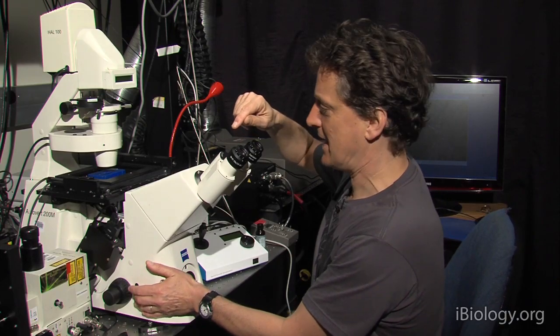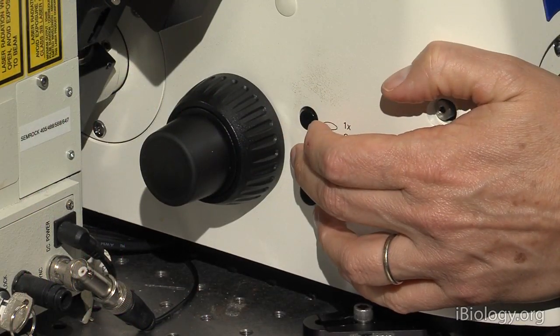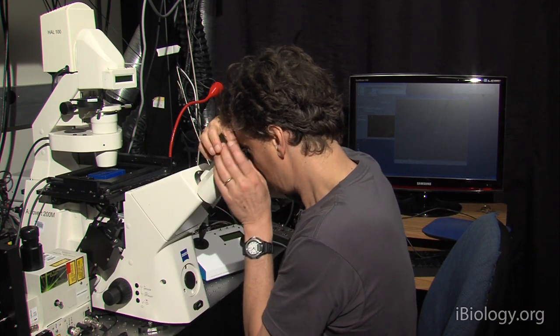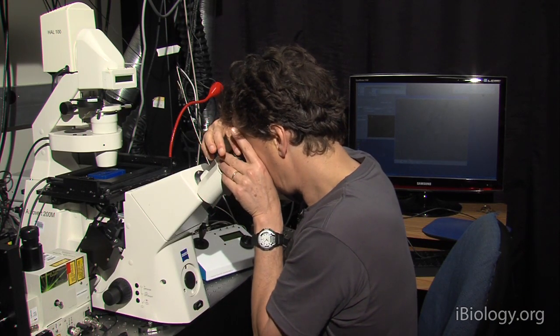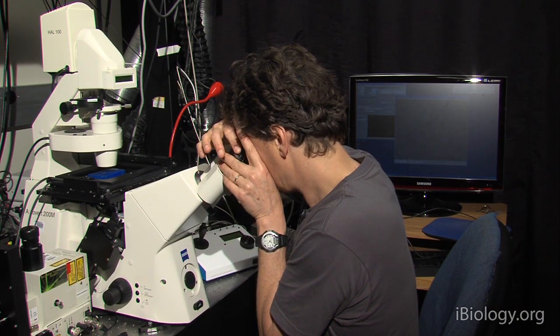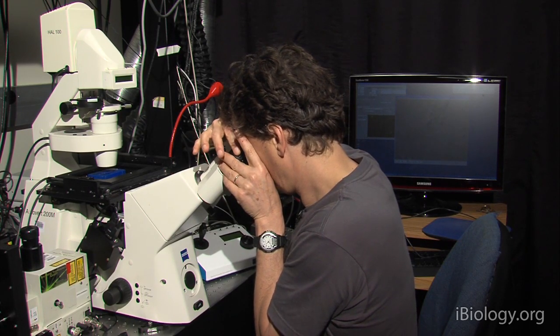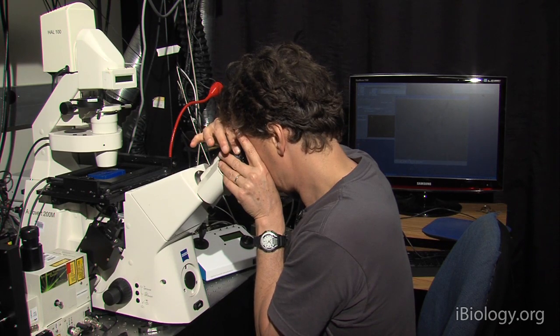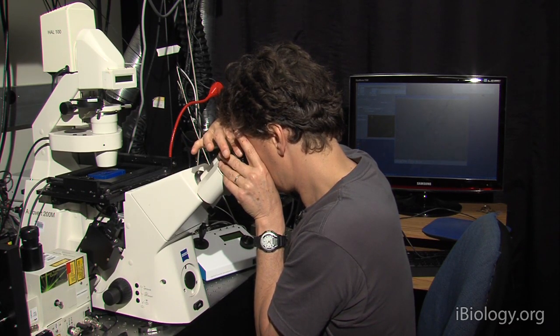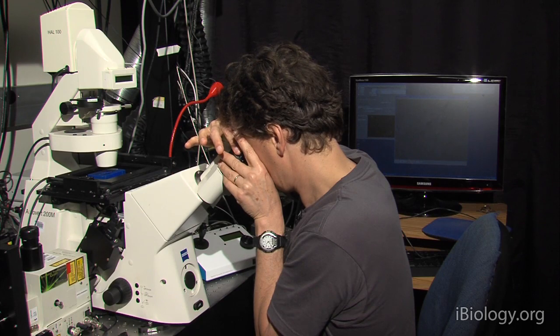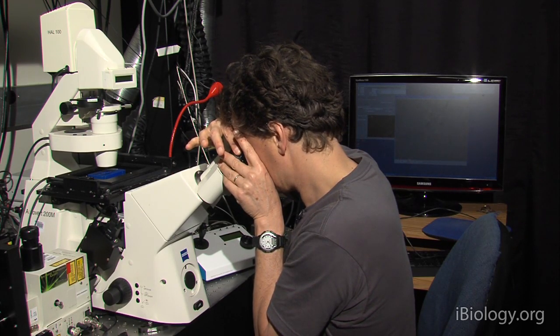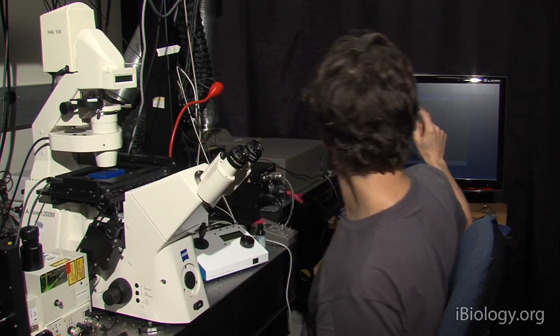So, I now will switch to the eyepiece and observe it through the oculars and then each eye individually will find focus. I'm trying to look at the same part that was observed on the camera there.